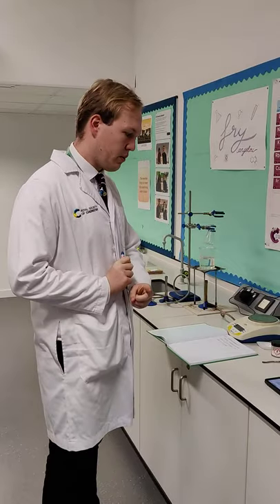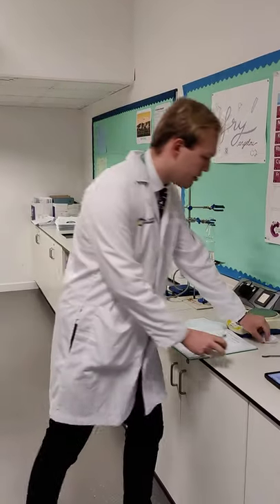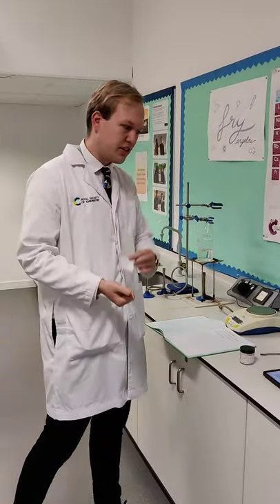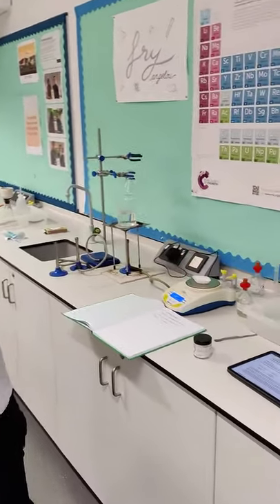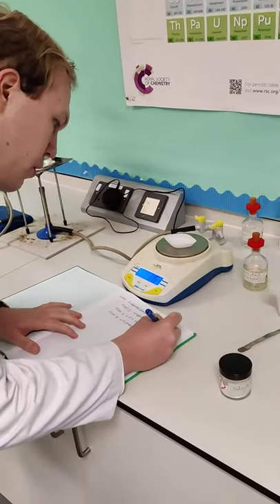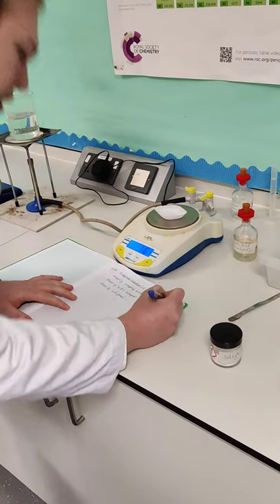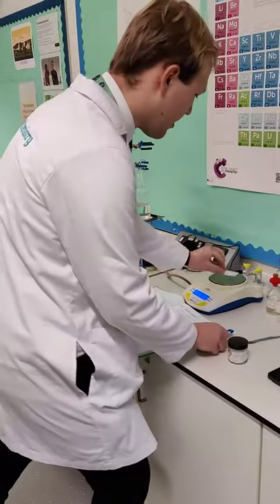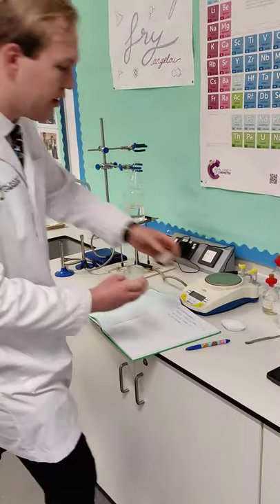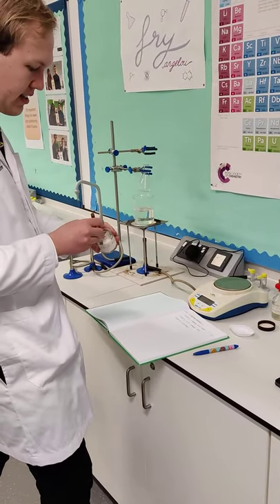The first thing that we're going to do is weigh out 6 grams of salicylic acid. To do this, we're going to be using a weighing boat. So the first thing that we need to do is obviously weigh the weighing boat. It comes to 1.15 grams. It's really important that you make a note of this so you don't forget what the mass of the weighing boat is. A good technique here is to take the weighing boat off the mass balance and put in the salicylic acid separately.